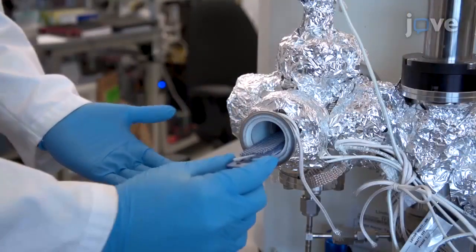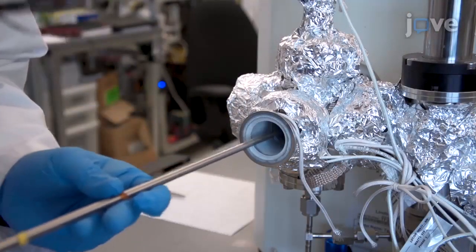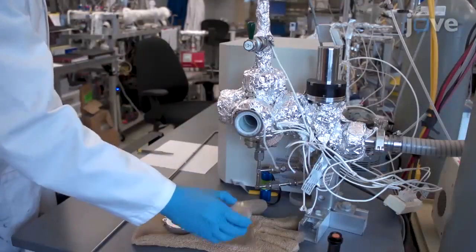After removing the reactor cap, load the fabric sample into the ALD reactor. Replace the reactor cap.